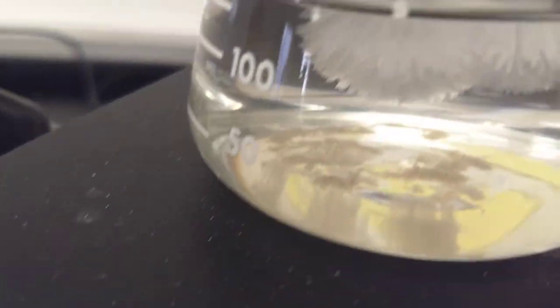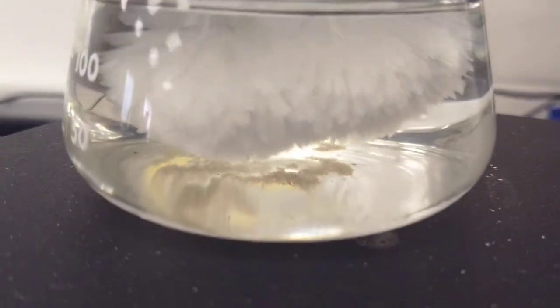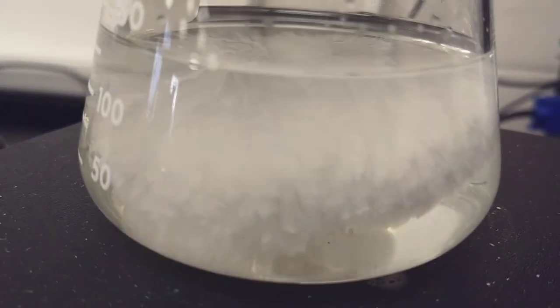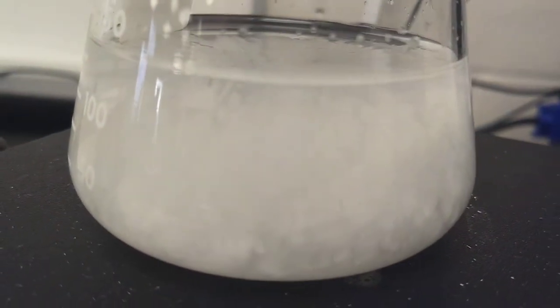There we go. There it goes. The crystal is just growing, growing, growing, filling up the space.